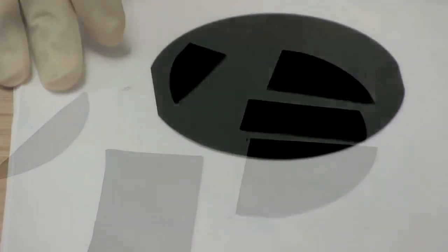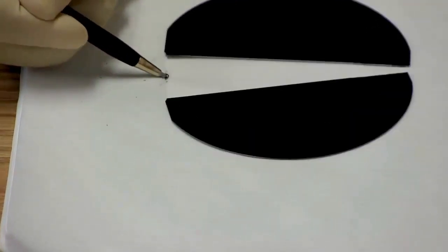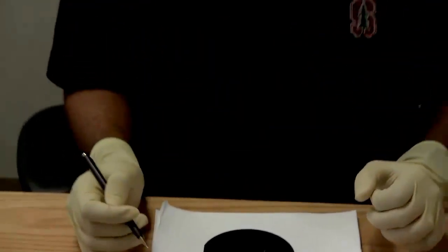I'm going to pull up one more wafer — again, along a crystal plane — and break it nice and clean. This is one way of doing it; you may find a way that works more comfortably for you. Make sure to practice this on dummy wafers before doing it on any of your good wafers.